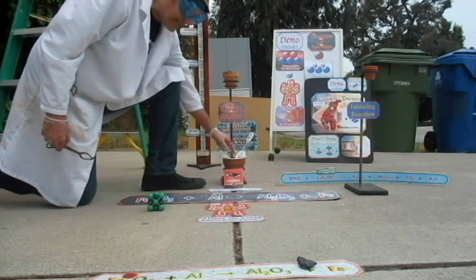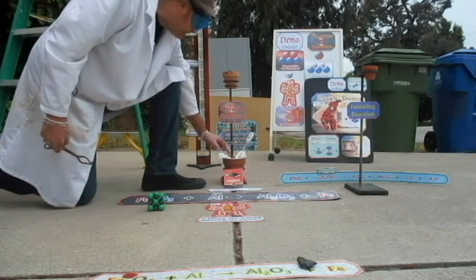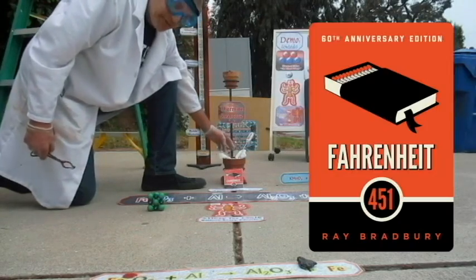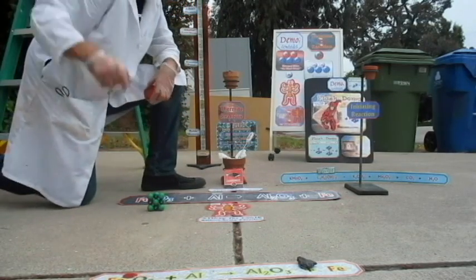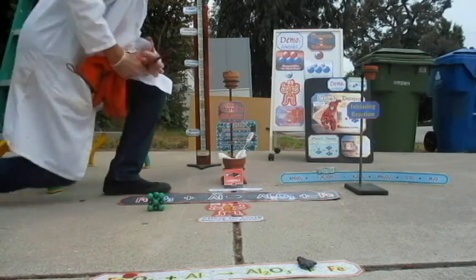Does it get hot enough to melt an ionic compound? Sodium chloride melts at 801 degrees. The thermometer might survive, we'll see. It'll tell us how hot it was over here. The paper, if it bursts into flames, that's Fahrenheit 451. I'm going to try to grab it while it's molten and show it to you and to my kids. It's a little hot, so I've got my thermal gloves.